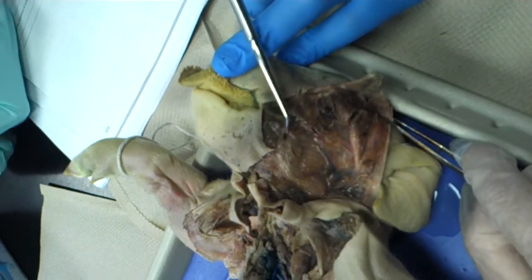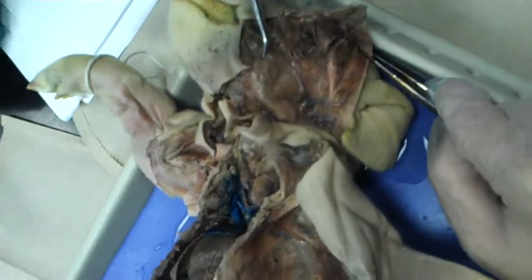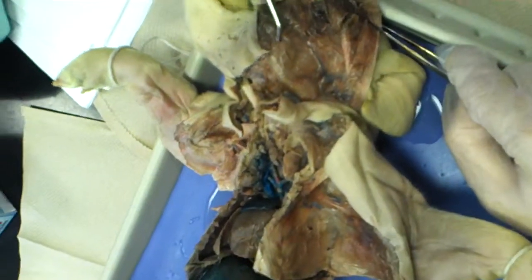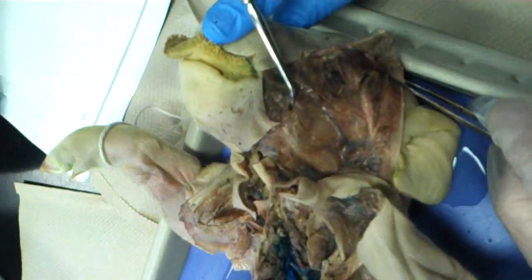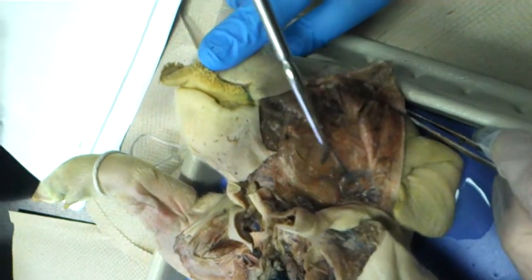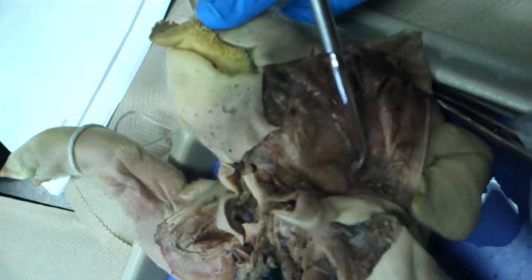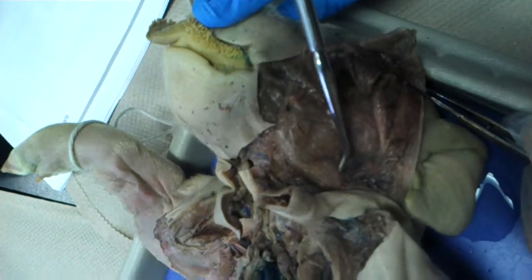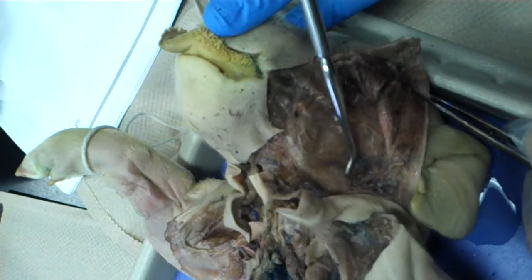Over here, that's the parotid duct. And then back here, behind the masseter, this is the parotid gland.